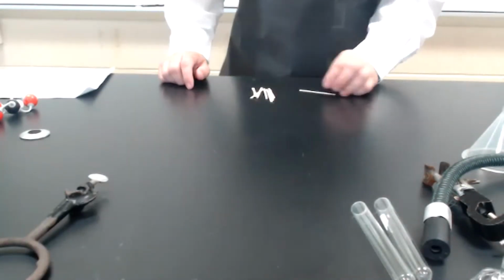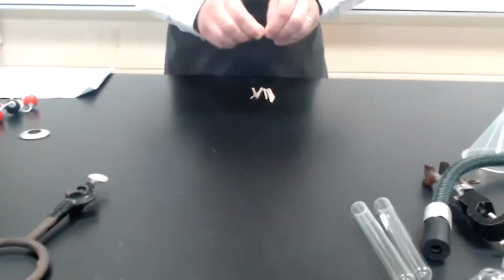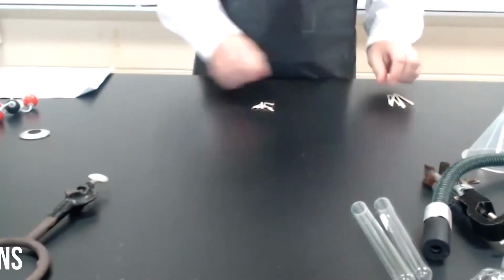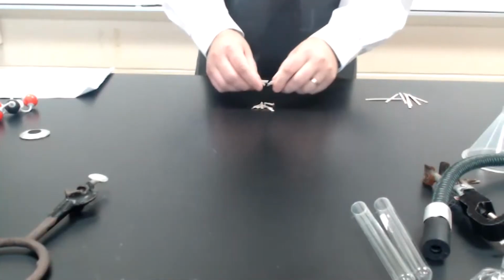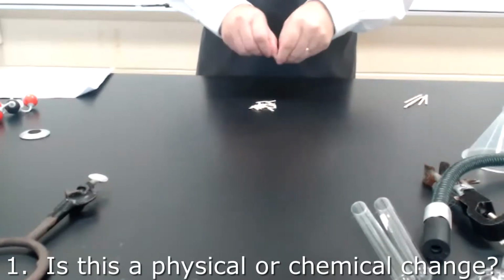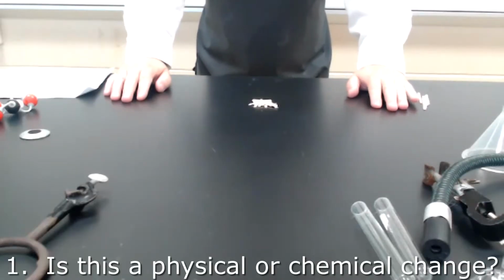As you can see, I have my toothpicks here. They're actually coffee stirrers that I've cut in half. I'm just going to break them into smaller pieces. Don't quite need all of these. Okay, there you have it.